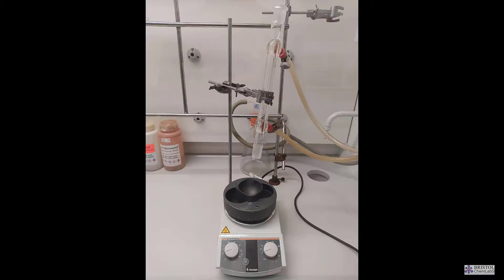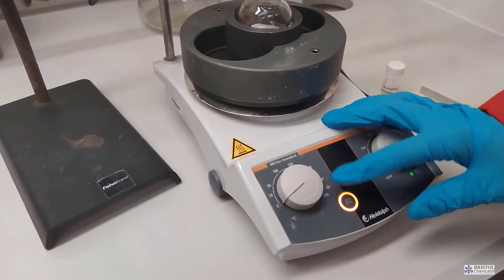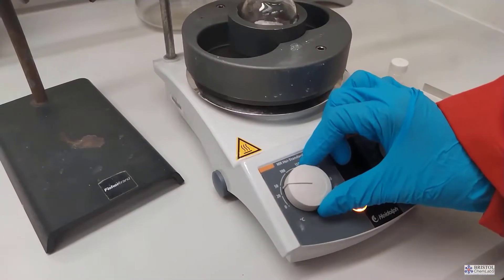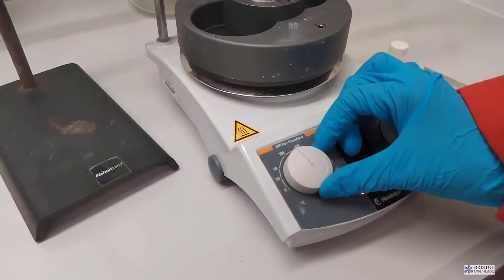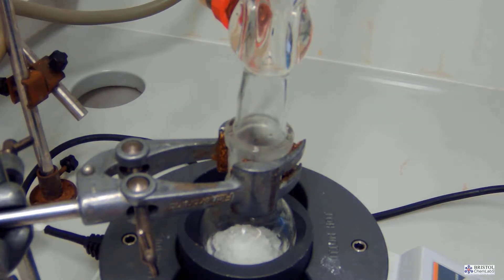Volatile materials used in organic chemistry tend to be inflammable. The heating mantle is also fitted with a magnetic stirrer which we're not using in this situation. A heating mantle also can be connected to a computer to heat up a reaction mixture at different temperatures over differing periods. The heating mantle also allows a more controlled heating to take place.